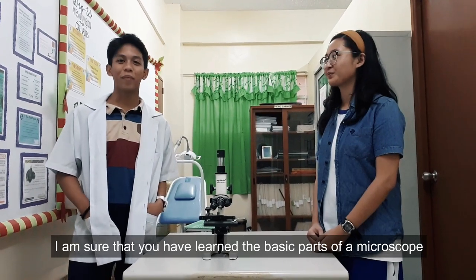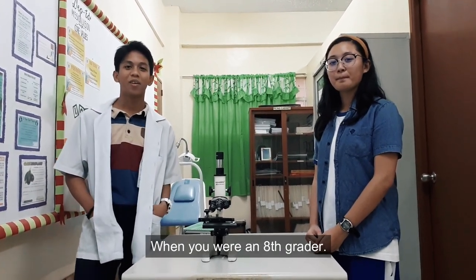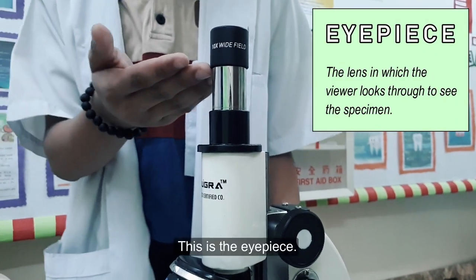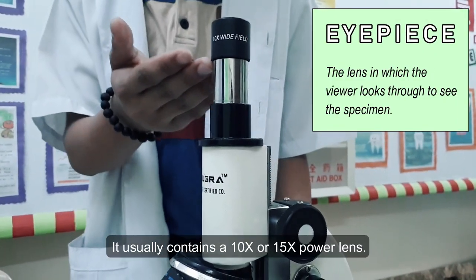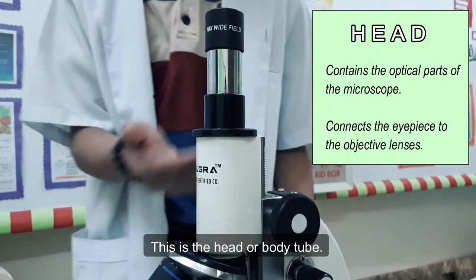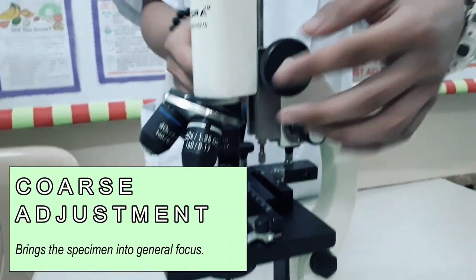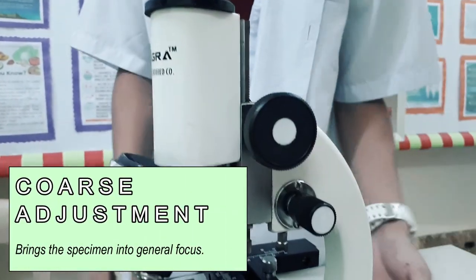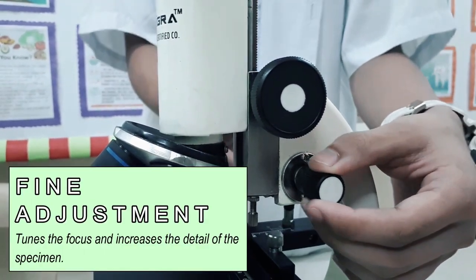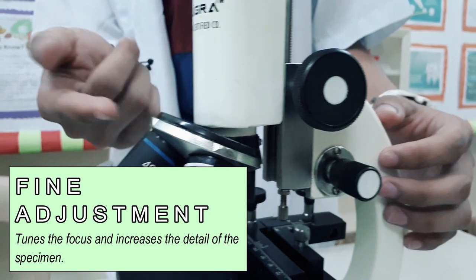I'm sure that you have learned the basic parts of your microscope before, but let's have a quick refresher. This is the eyepiece — it usually contains a 10x or 15x power lens. This is the head or body tube. The arm. The coarse adjustment — it brings the specimen into general focus. The fine adjustment — it tunes the focus and increases the detail of the specimen.